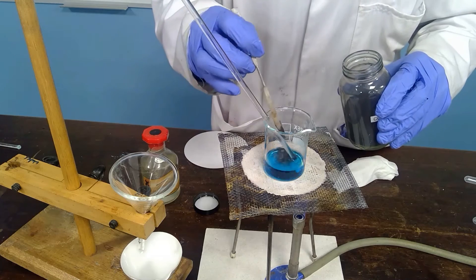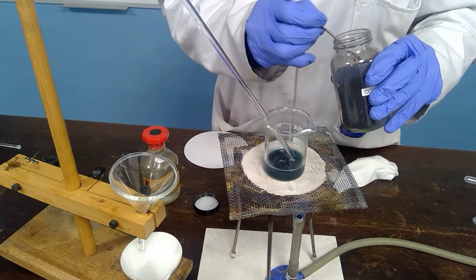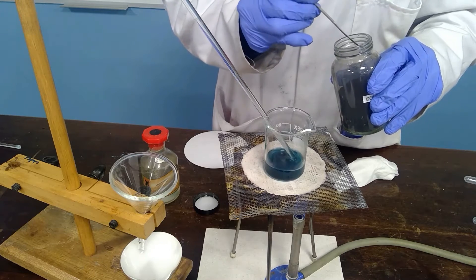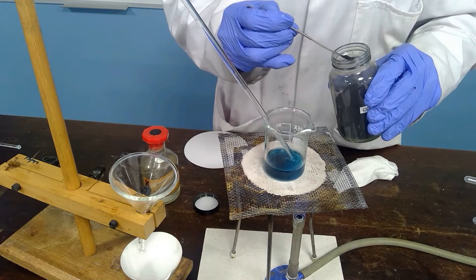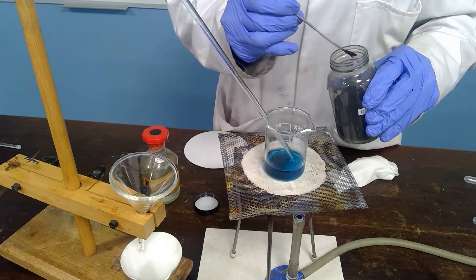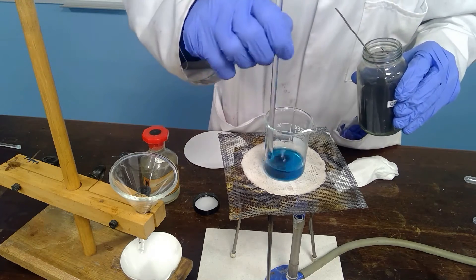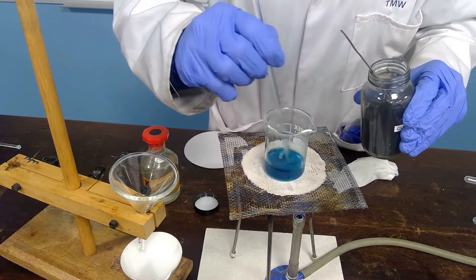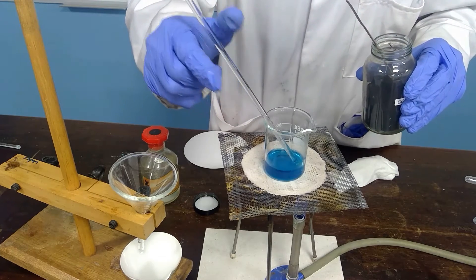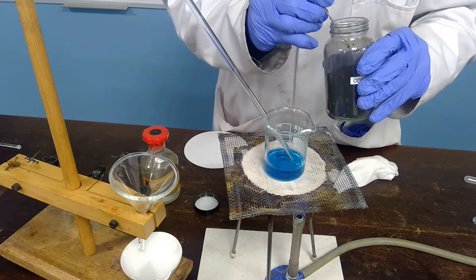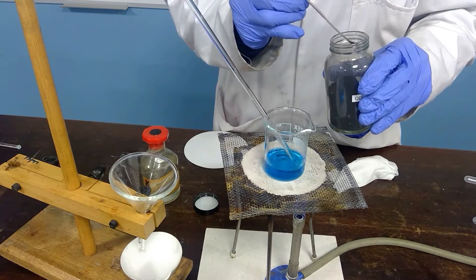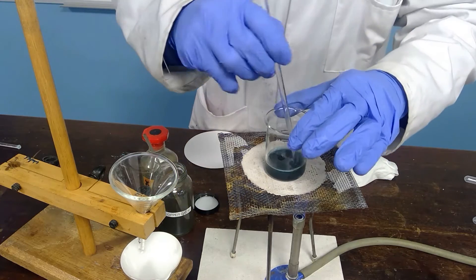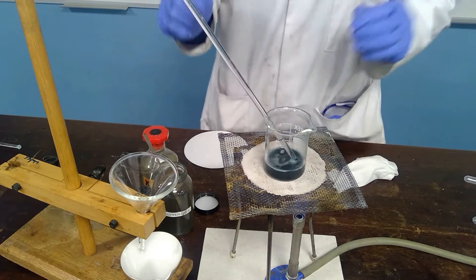Continue to add and allow it to disappear. Our aim is to add a very small quantity above the neutralization point. We allow that one to react.